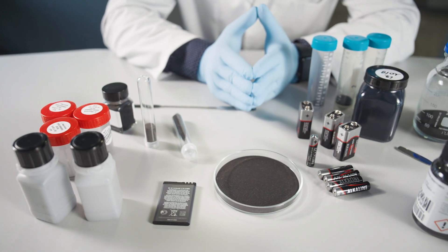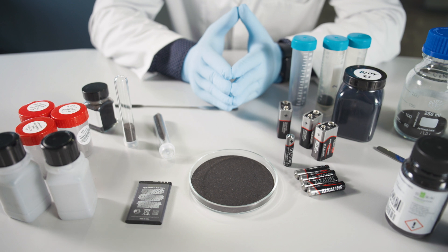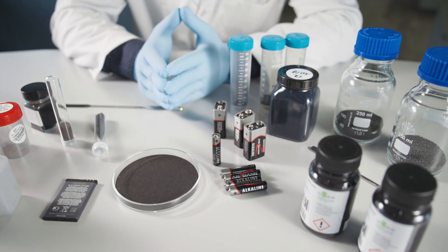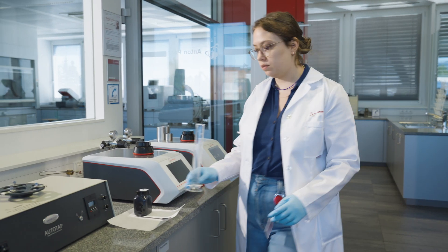Tap density, also referred to as bulk density or packing density, is an important parameter when characterizing powder electrode materials, since it has a direct effect on the efficiency and energy management of a battery cell. It includes the volume of the solid phase, the volume of the spaces between particles, and the volume of pores within particles.